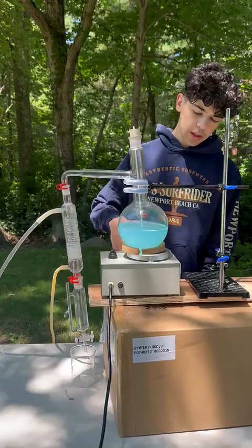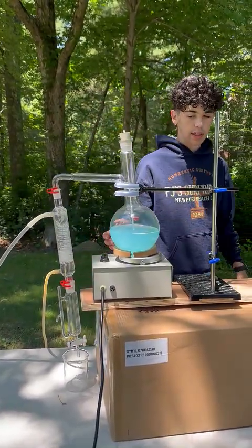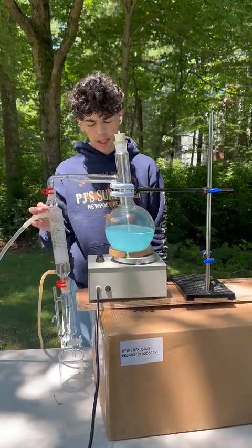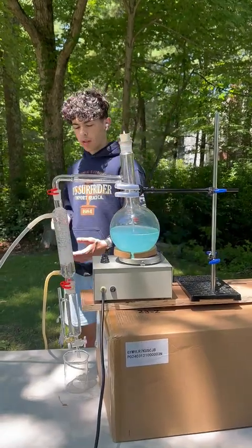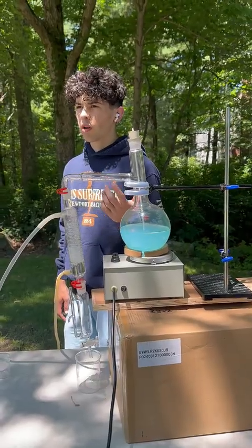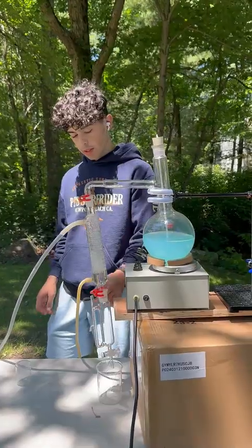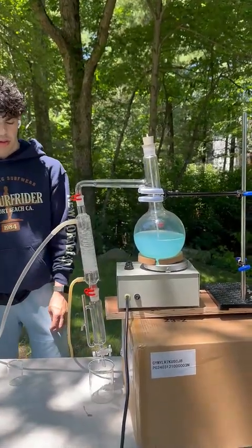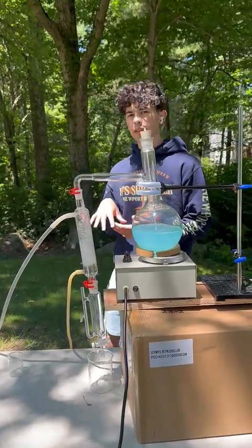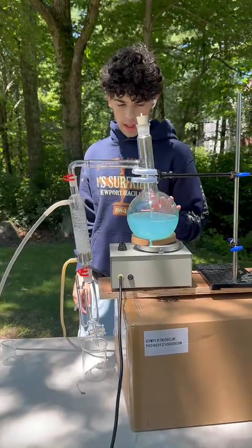Then slowly but surely, it'll start becoming more and more acid to water ratio, and you'll see it start to make some lines, kind of like perforations, kind of like when you add alcohol to water. And then what's going to happen is I'm going to take a little droplet from a pipette and put it on some paper, and if it burns the paper, that means it's concentrated enough for me to actually start collecting. So yeah, this is going to take a very long time.